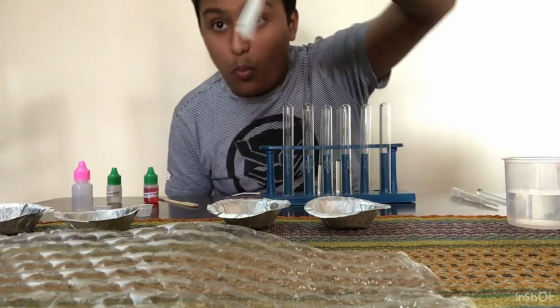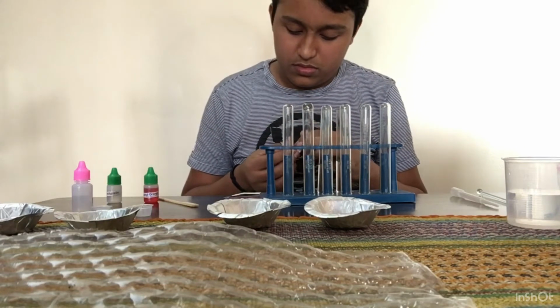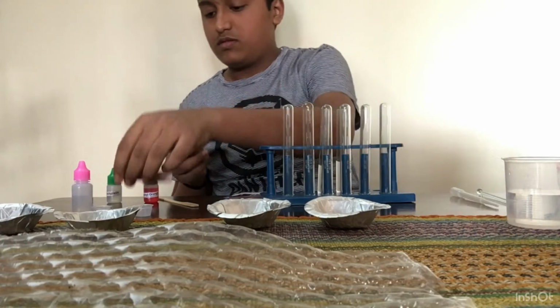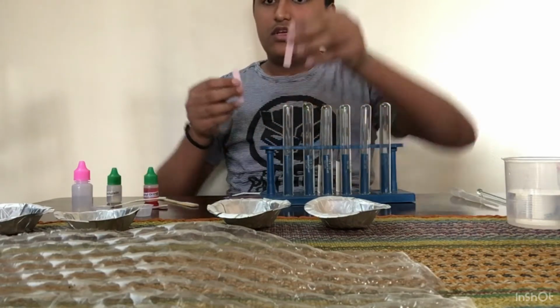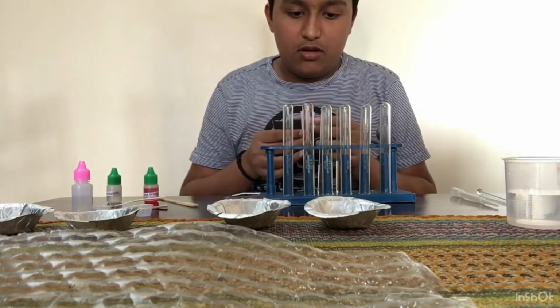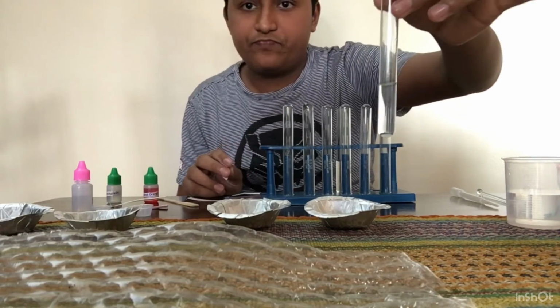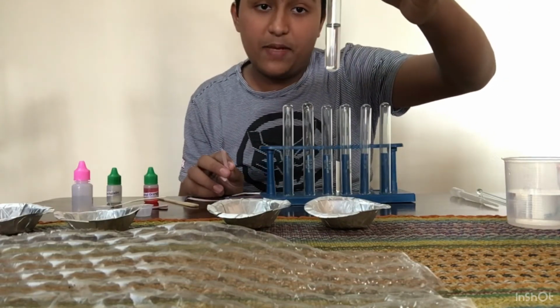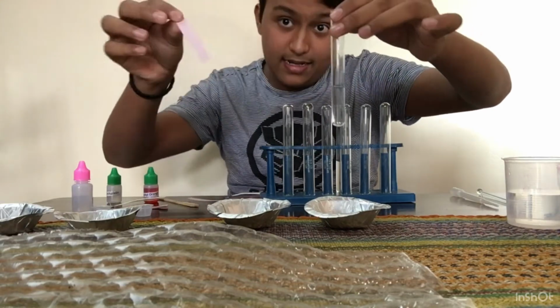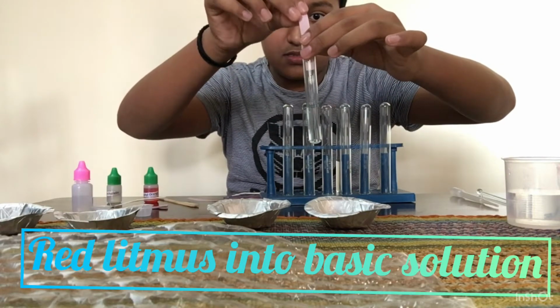So let me take out one red litmus. Let me take out two because we have to check it. So here you can see I have taken two litmus papers. Now you can see here I have the basic solution, and I'll put this red litmus paper into it and see what happens.